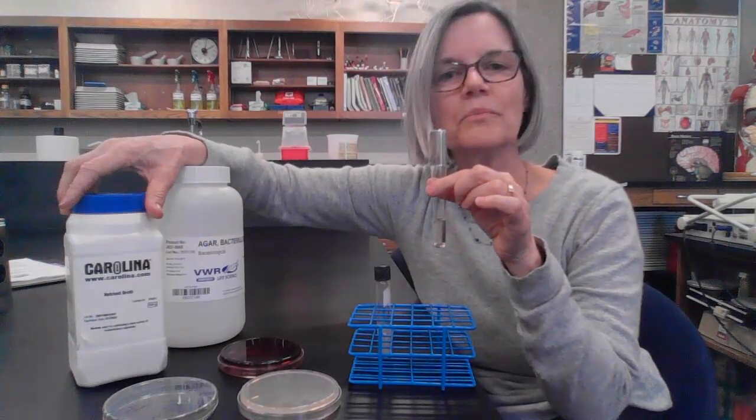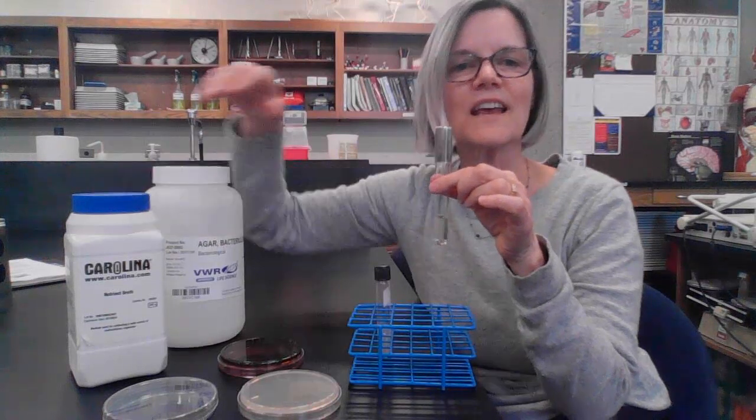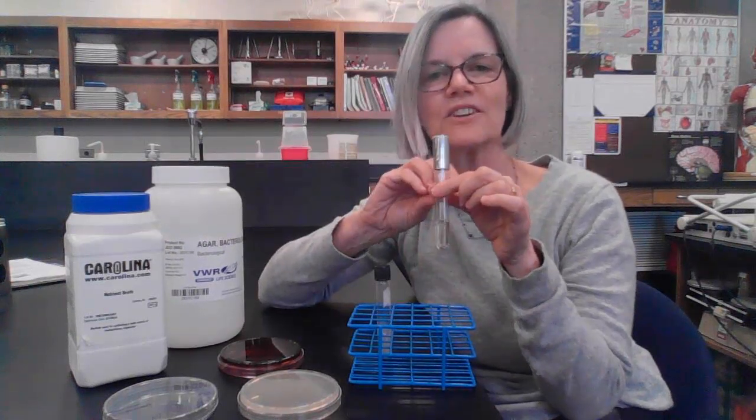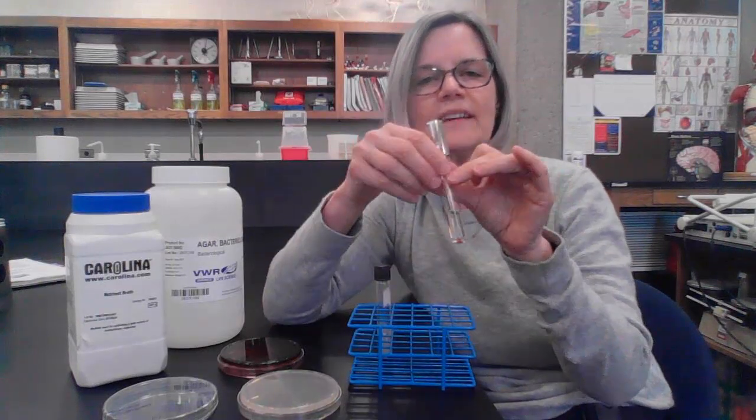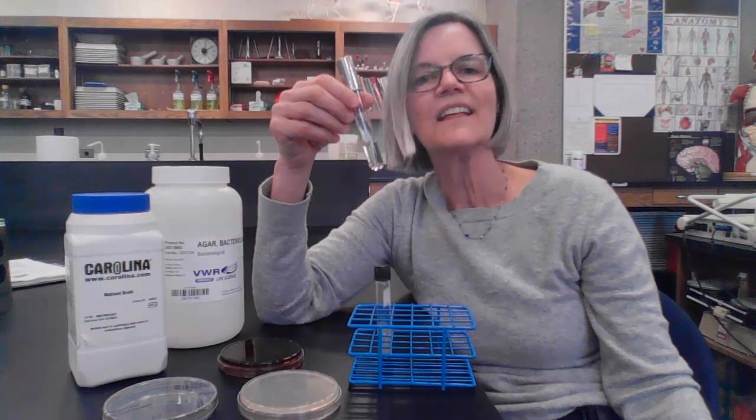And when you add water to this and put it in tubes and sterilize them, you'll get what we call nutrient broth. And when we use nutrient broth, we generally use it if I'm going to grow some bacteria in a short period of time, usually overnight, and I'll inoculate it. You'll see in another lab how to do that, and bacteria will grow in here, and I'll have some fresh growing bacteria the next day.